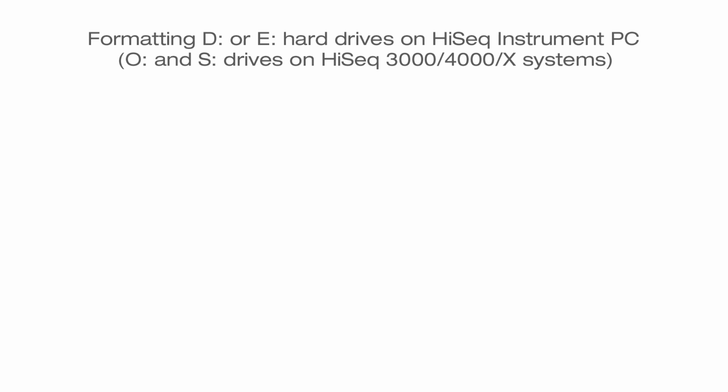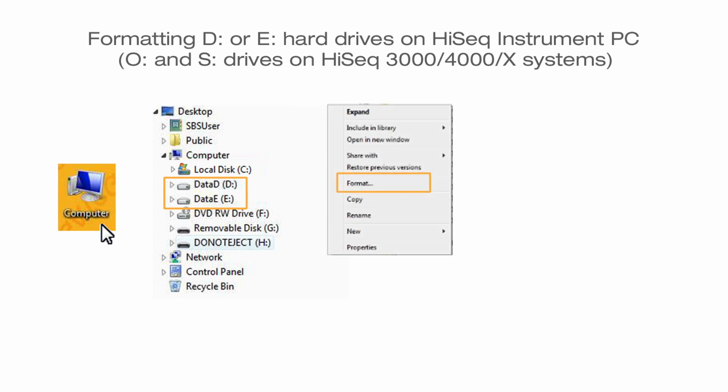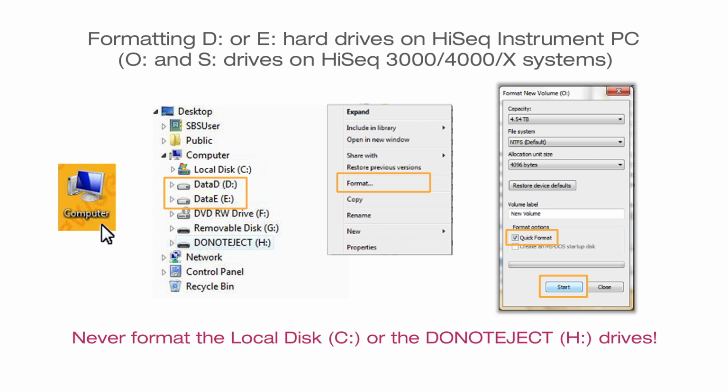To format the drives, from Windows, open Computer to show the list of drives on the computer. If working with the D drive, move any files still needed to the C drive, specifically Illumina maintenance logs if present. Right-click the D or E drive and select Format. D is for data generated from flow cell position A. E is for data generated from flow cell position B. From the Format dialog box, select the Quick Format checkbox. Select Start.